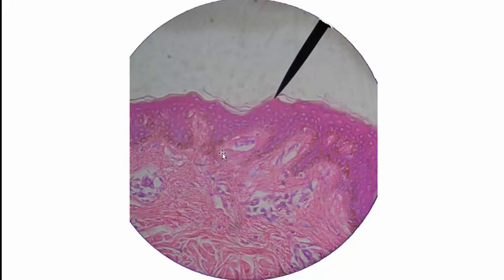And I haven't noticed on my slides receptors in the dermal papillae. I'm sure they're there. They're probably just dispersed. On thick skin, think of the fingertips. They're very sensitive, so we have a lot more receptors there. The back of your hand, thin skin, doesn't have as many receptors. You can still feel touch on there, but you can't feel touch as finely on thin skin as you can on thick skin.